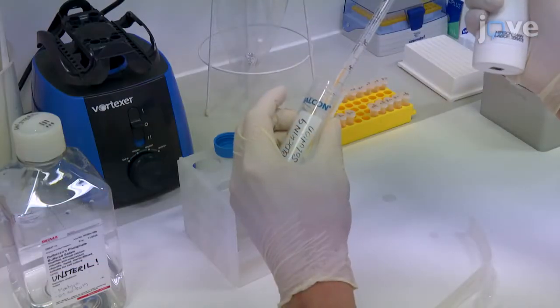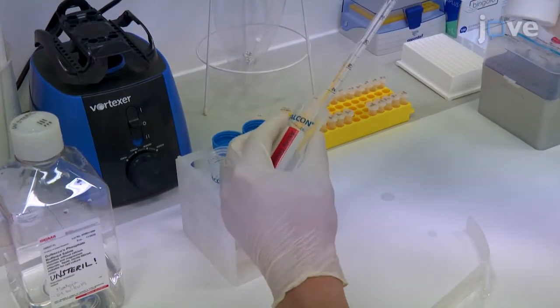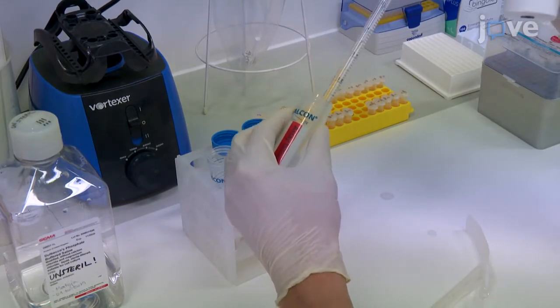To prepare the assay diluent solution, 1% blocker A in PBS, add 5 ml of blocking solution to 10 ml of PBS.